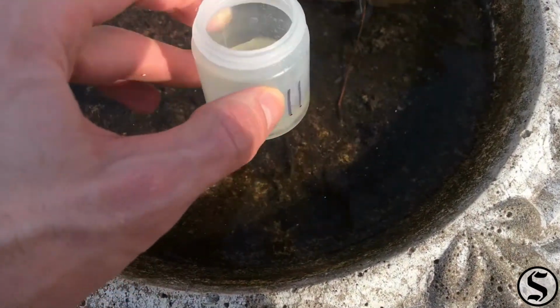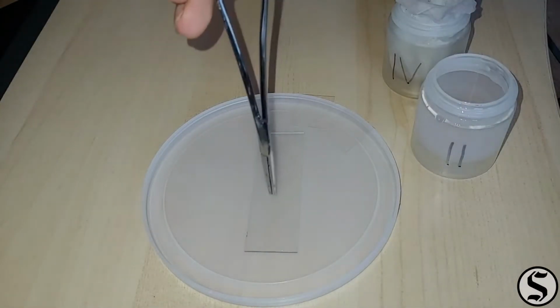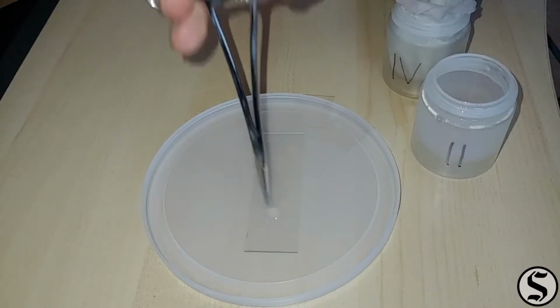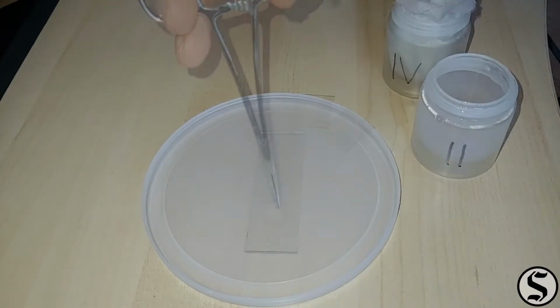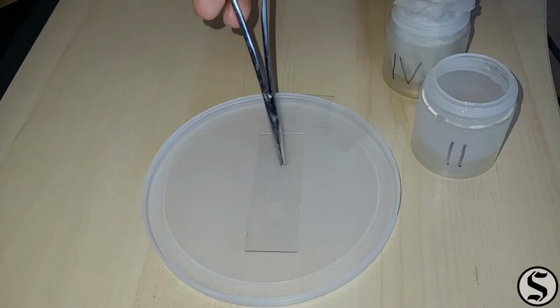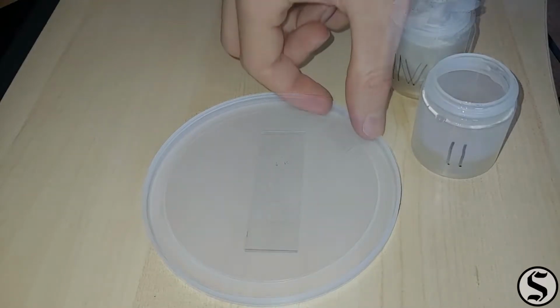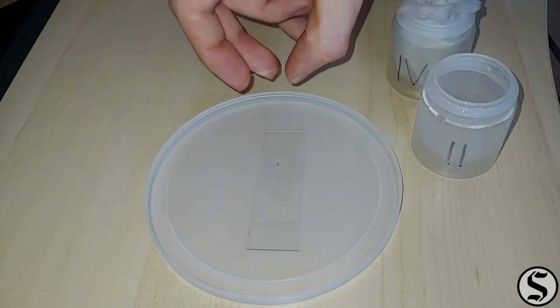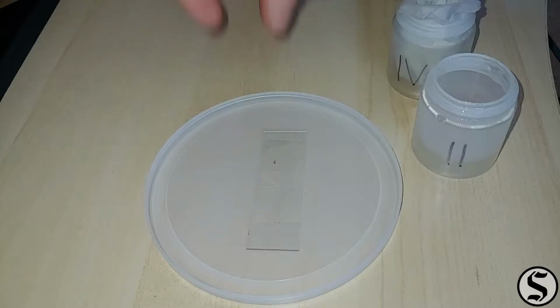Today's sample from Birdbath A was done to test some filtering. I collected some water. There's going to be some suspended sediment in that, but I didn't collect any of the sediment at the bottom. And I ran about 4 ounces of that water through a coffee filter, which concentrated it into a kind of sludge that I could just scoop right up. So let's check it out.